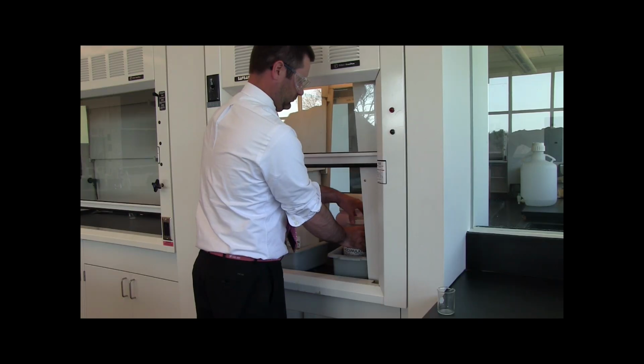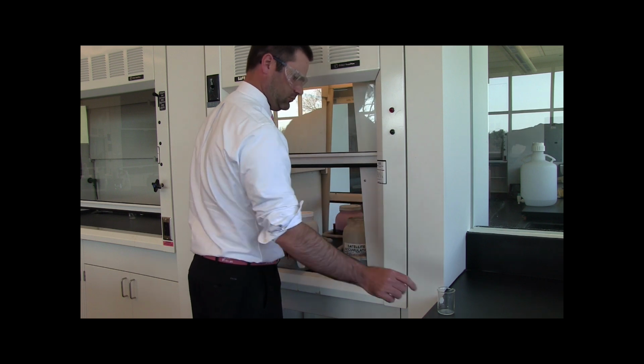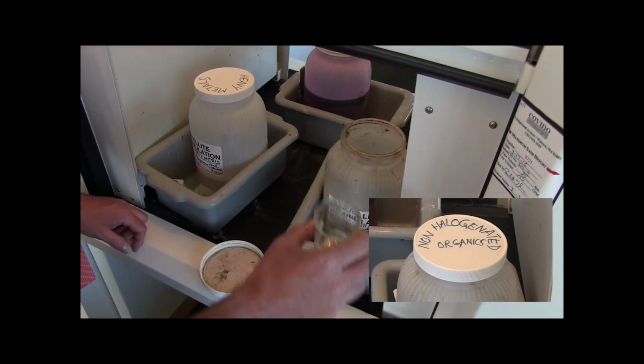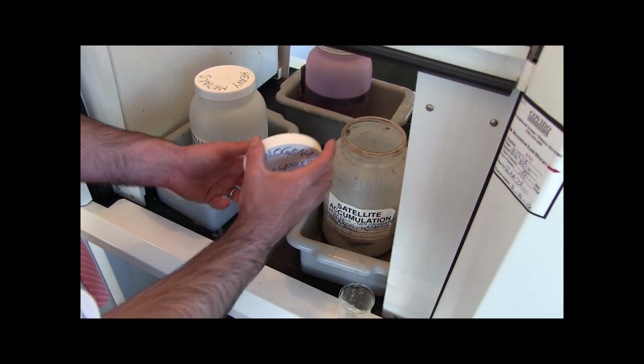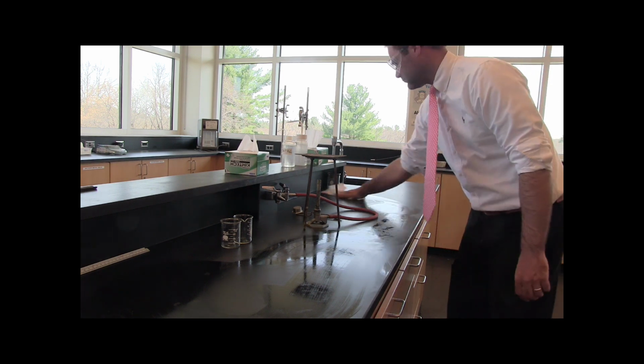While the beaker is heating, we can use this time to start cleaning up. Dispose the beaker with the decanted acetone in the container labeled non-halogenated organic waste. You can also tidy up your bench by using a paper towel to wipe it down.